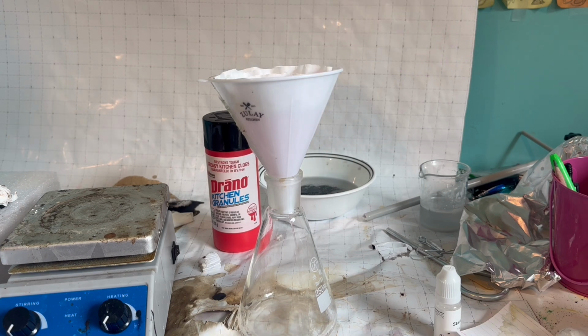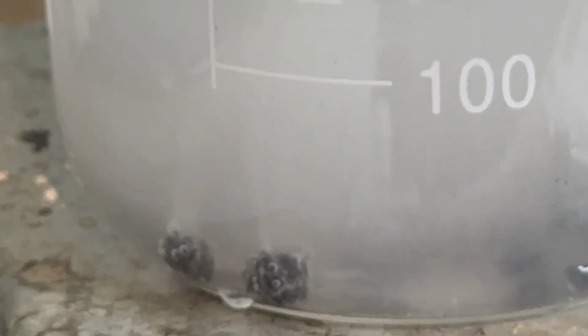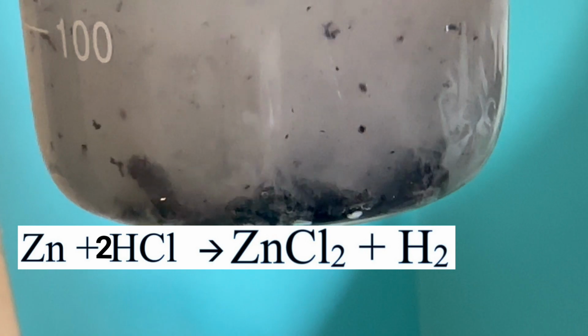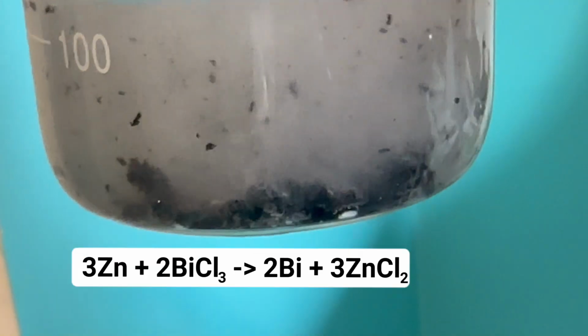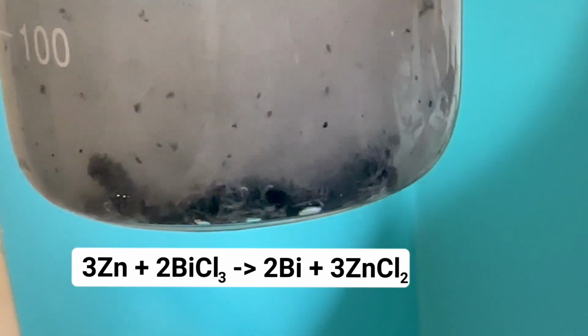After I felt that the reaction was complete, I filtered everything off and added some zinc granules. The zinc begins to bubble, and once again, 2 reactions are taking place simultaneously. First, the zinc is reacting with the acid to form zinc chloride and hydrogen gas, and second, the zinc is reacting with the bismuth trichloride to form bismuth metal and more zinc chloride.